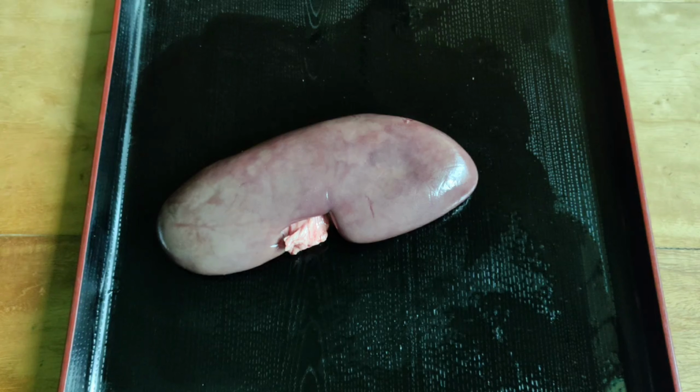Pack your dissecting kit, ready your kidney, your pan, and your gloves, of course. I know what you're thinking, everyone. The kidney looks awful because it is missing the veins and arteries that I'll be needing. However, nothing can stop us nurses from doing what we can to finish the job. I'll explain what I can.